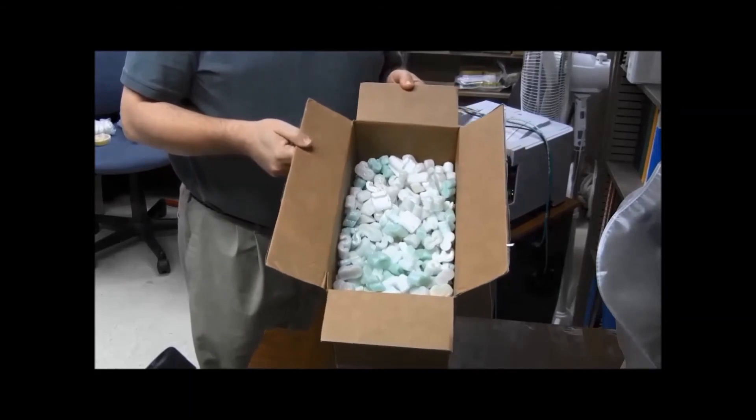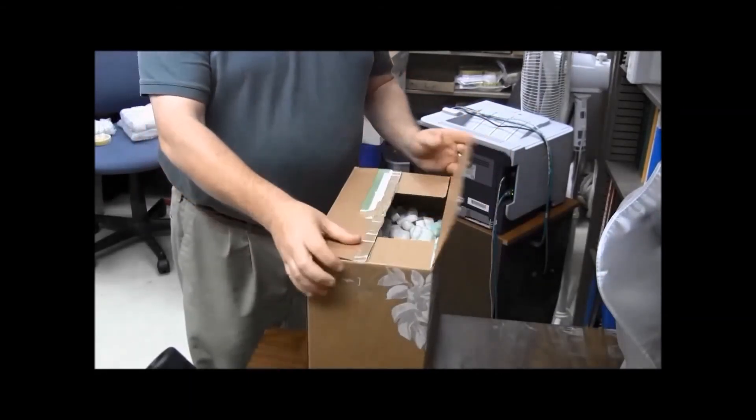So make sure you have plenty of cushioning, fill it to the top, and then you're ready to go.